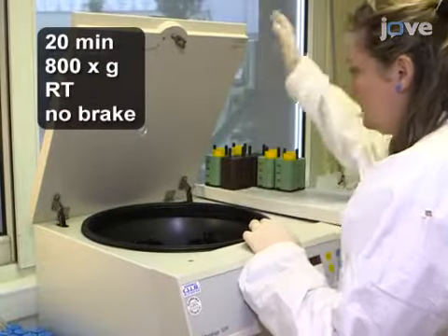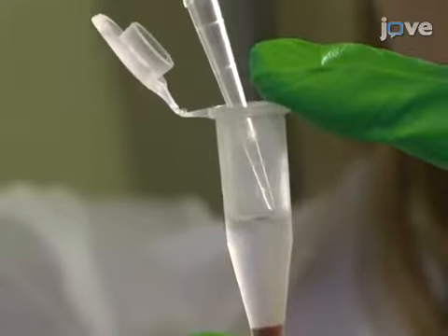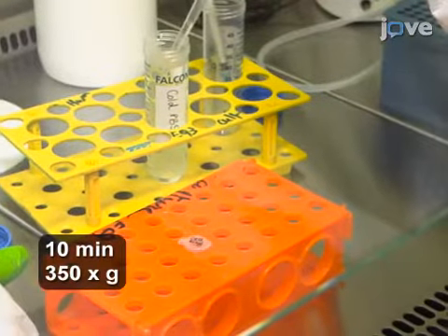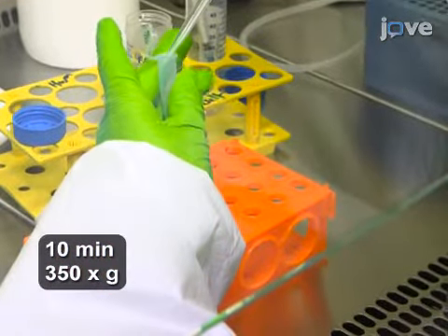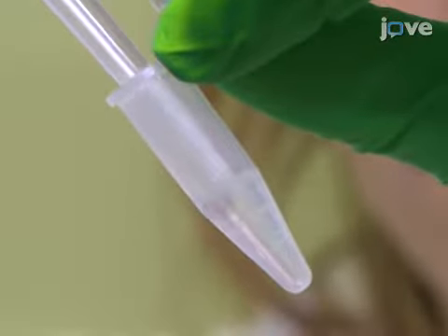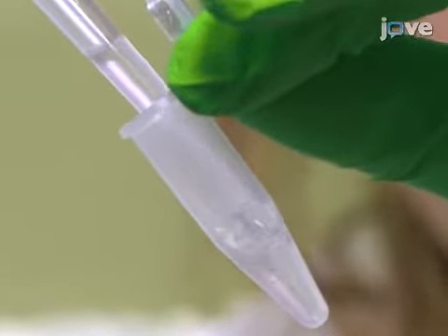Separate the cells by centrifugation and use a pipette to transfer the opaque white mononuclear cell layer into a new microcentrifuge tube. Then wash immune cells in 1 ml of PBS, centrifuge them, and resuspend the pellet in 600 microliters of FACS buffer for staining and analysis by flow cytometry.